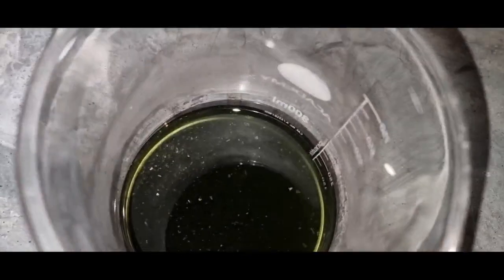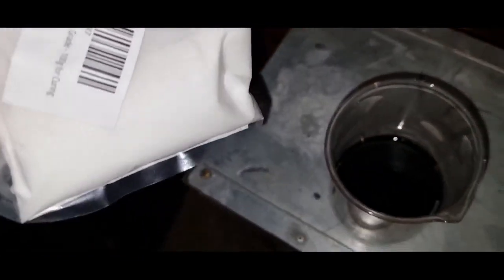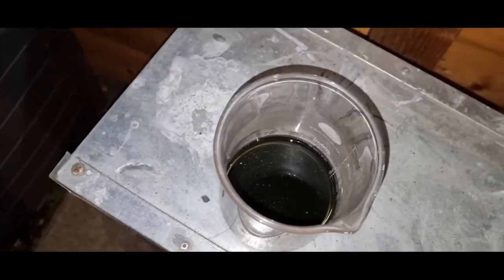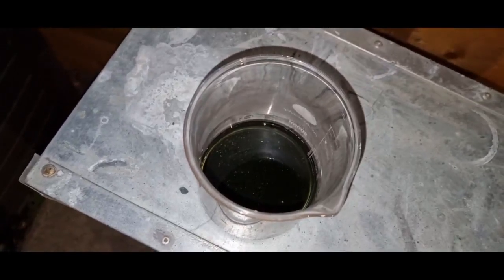So in there is hydrochloric. It looks worse but I've left it overnight and it's turned a bit green but it should be fine. I'm going to add in salt peter or sodium nitrate. It's the same and we put it on heat. And I'll come back when it's finished on the heat and dissolved all the gold.